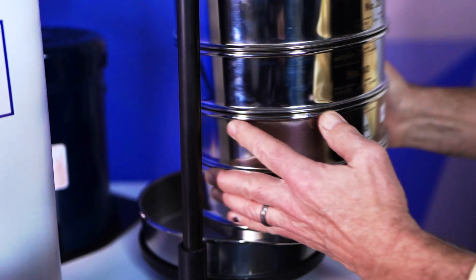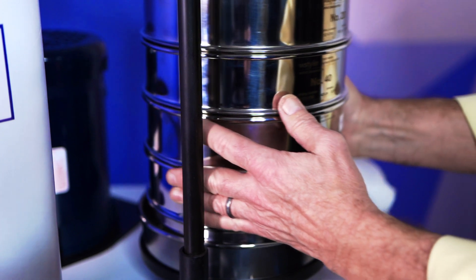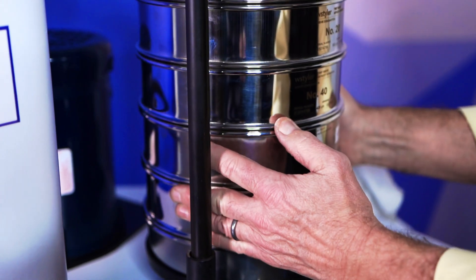Not all sieve shakers can fit all sieve diameters. The RX29, for example, is designed to test sieves with an 8-inch diameter, while the RX30 is made to work with test sieves that are 12 inches in diameter. The best way to identify which sieve shaker is right for your company is to refer to your industry standards — they'll have insights into the specifications your operation should feature.